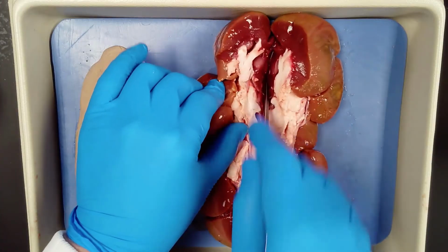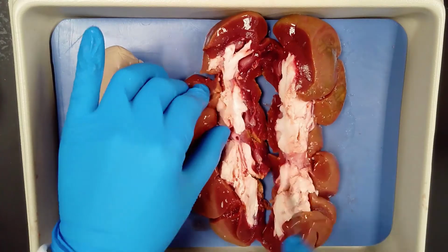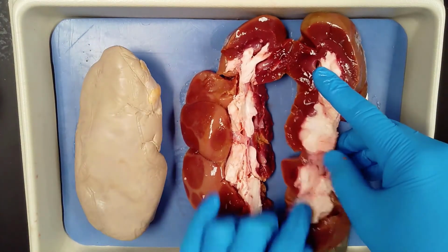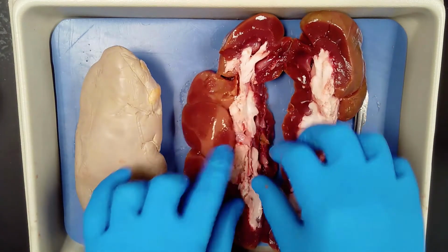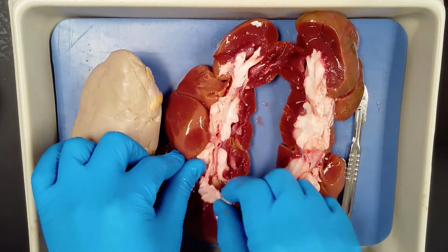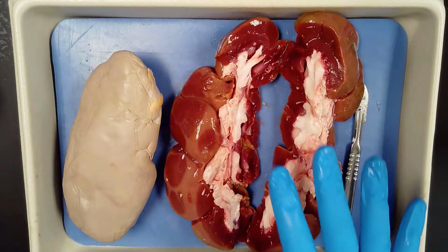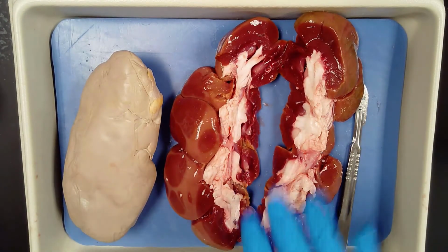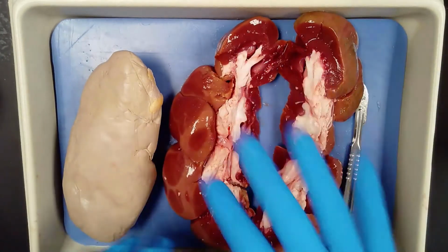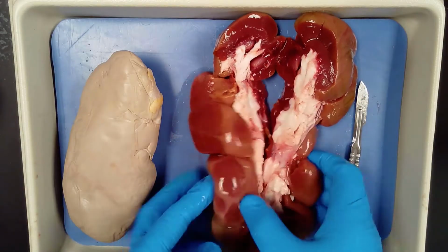We'll talk about some of these structures. They're a little bit easier to see in the pig than in the cow. But you can see in here some of these structures, some of the tubes, the ducts. Here's the ureter, a little bit of fat, but that's the difference. You can totally see how vascular it is, and that's what I want to show on this fresh kidney, how vascular it is, how much blood is actually contained in there, and then some of the inside components. Let's set this aside.